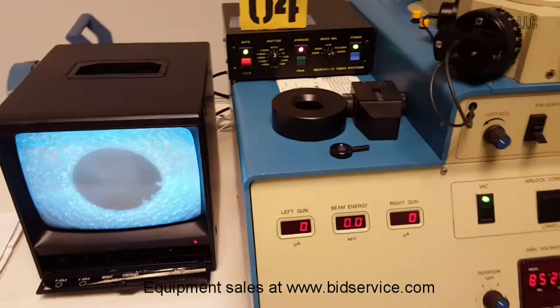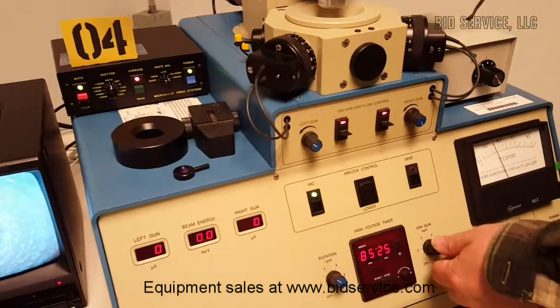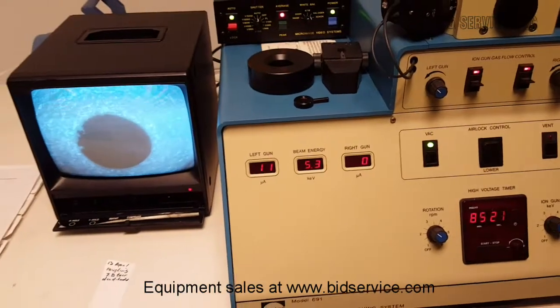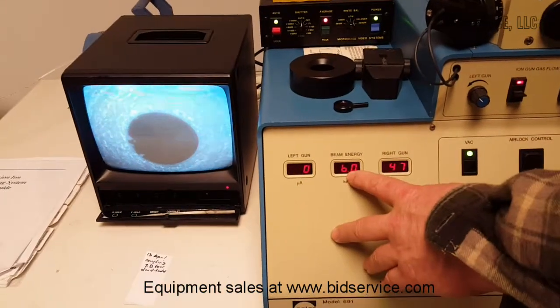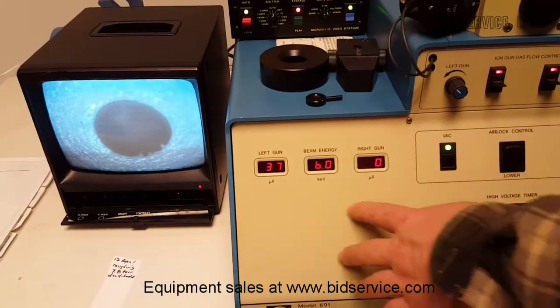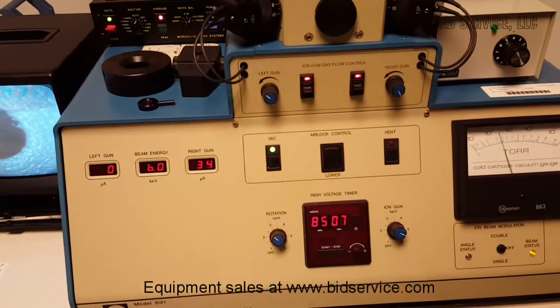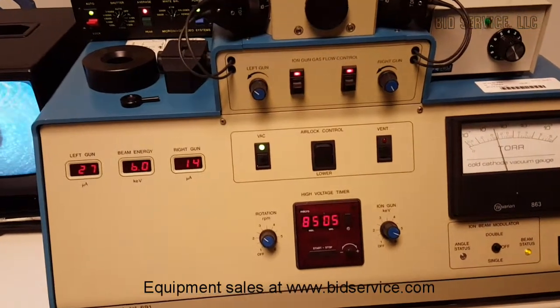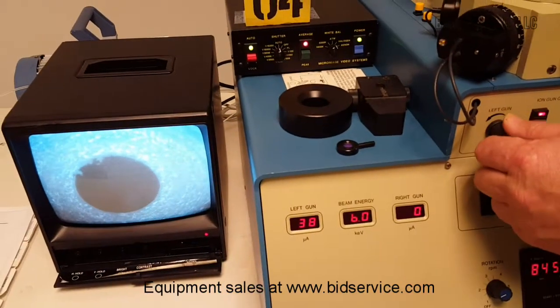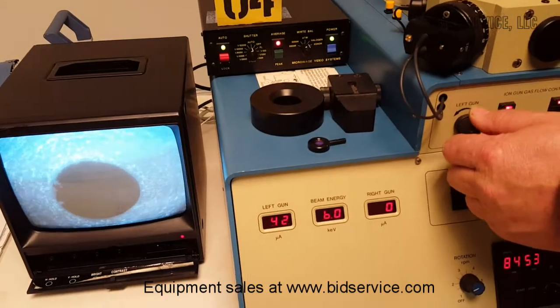What I'm going to do now is just turn on the argon and then turn on the high voltage. As you can see, the beam energy is coming up, and you can see the right ion gun come on — now it just switched over to the left. It keeps flip-flopping because it's set to double. If I change it over to single, it'll only do one side. I'm going to slow it down, and you can see that I'm able to adjust the gun current by how much argon I let into the system.